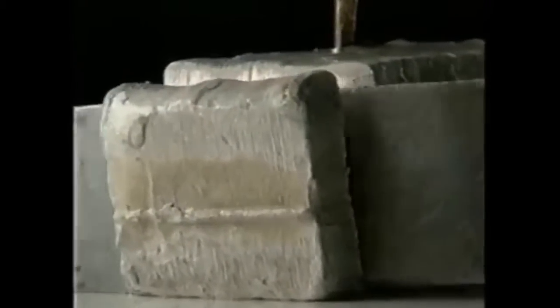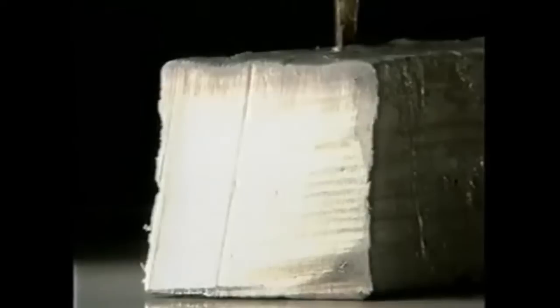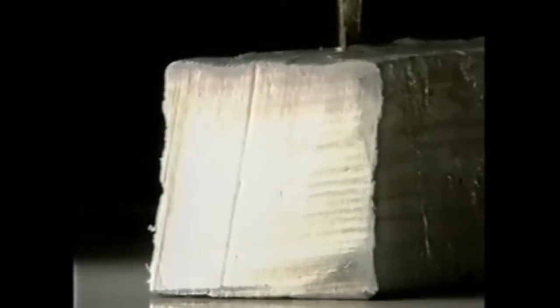This is sodium. It's even easier to cut, and again, the shiny surface soon discolors.